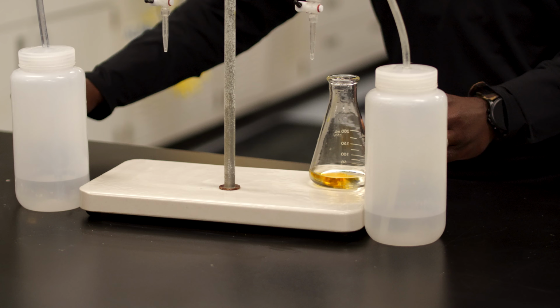Today I'm going to show you how to do an acid-base titration. It's a technique used to calculate the concentration of an unknown bath. Today I'm using our Aqueous PL918, which is a caustic-based cleaner. I also have HCl here, and then I also have the indicator. And since we know the concentration of the HCl, we're able to calculate the concentration of the unknown bath.